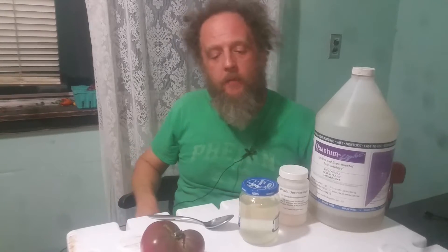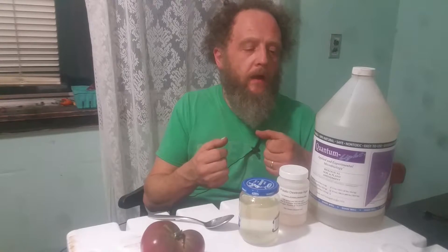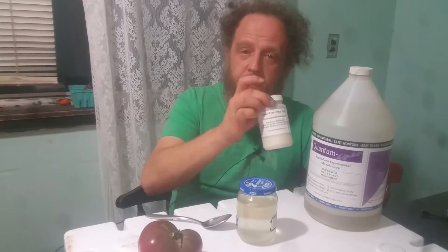I'm not sure, but I'm thinking it might — but maybe not. I don't think it's as easy as that, but this is an experiment, and I love to try different experiments. This is the first time I've tried this, but I have done things with the potato agar before with other types of bacteria and had really great success.